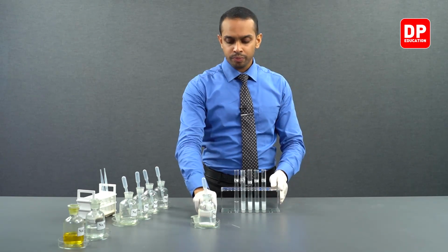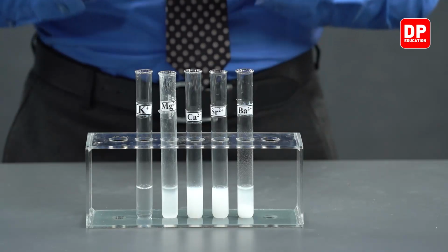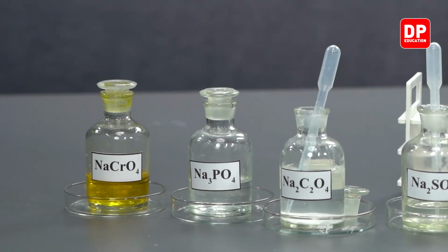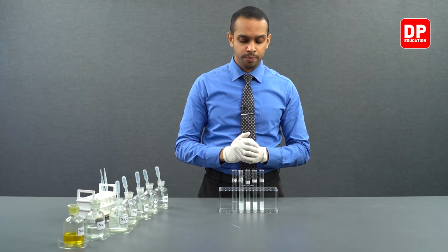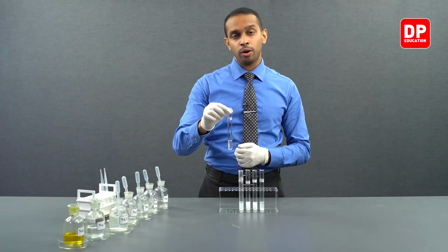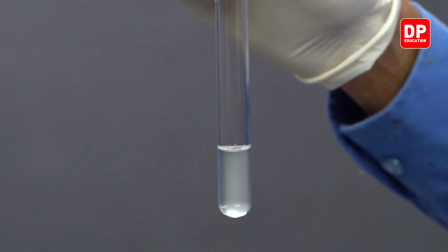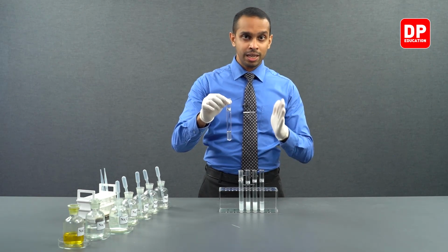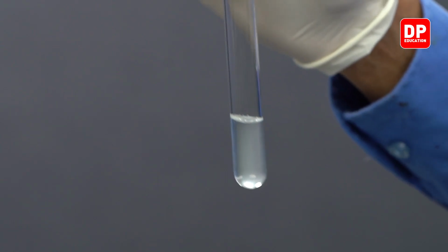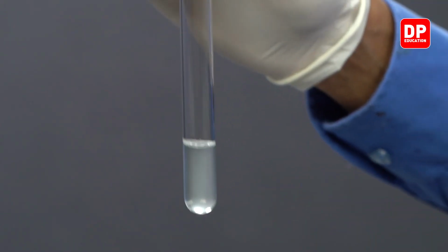Now students, let's take a look at the summary of what happened when we reacted oxalate anions with the cations we have in front of us. When we reacted potassium plus cation with oxalate anion, we saw that we did not form a precipitate because potassium oxalate that is formed in here was water soluble. The salt potassium oxalate is soluble in water.